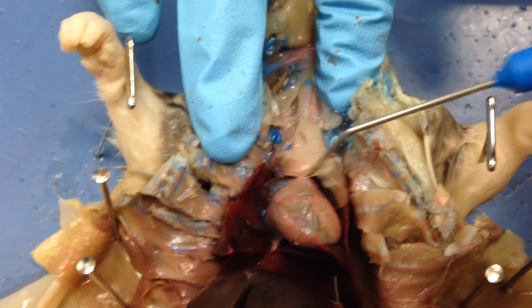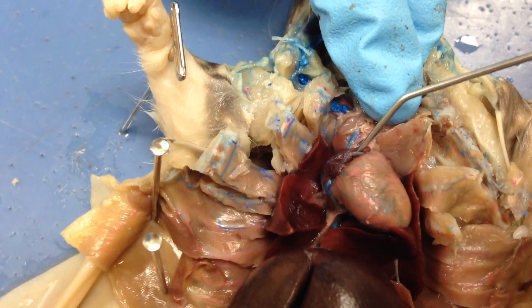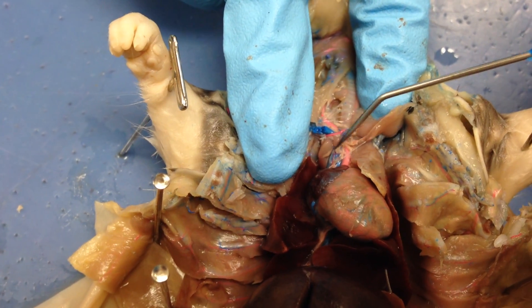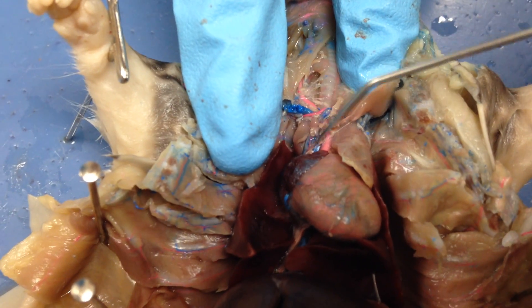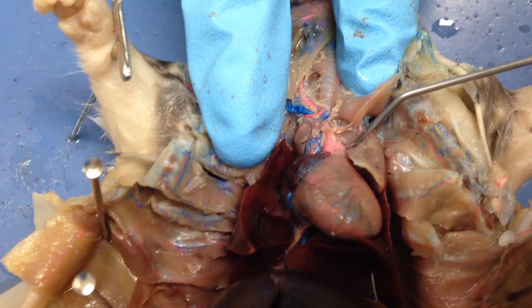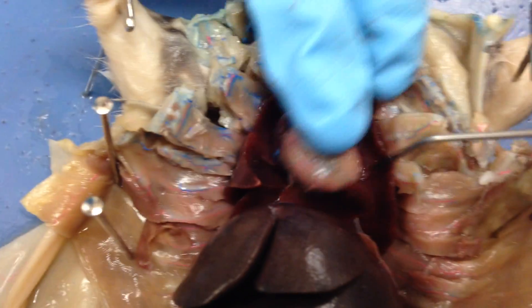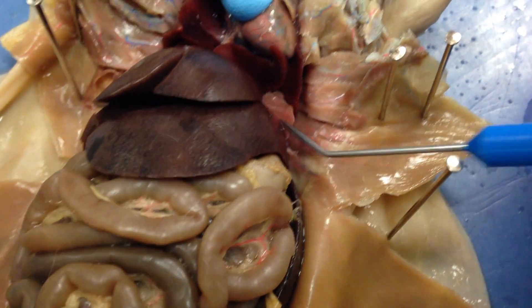When we move past, we have our heart. We have our ventricles and our aortas — they're just different colors. You have your vena cava and the aorta; the vena cava will be blue because it's along the lines of the veins — veins are blue. The red or pinkish color, those will be your arteries or your aorta. When you pass the heart, you have these lobes over here — these are your lungs off to the sides.